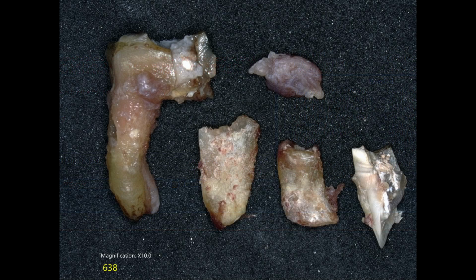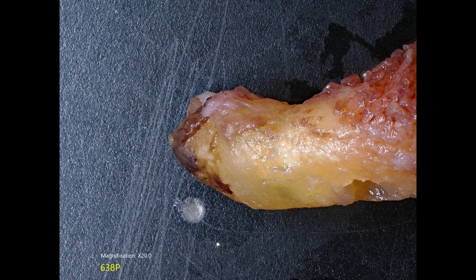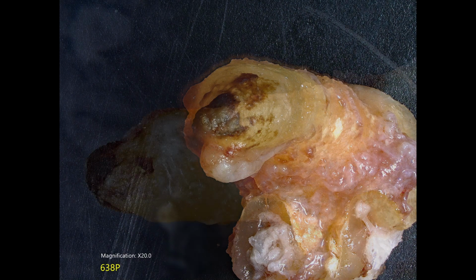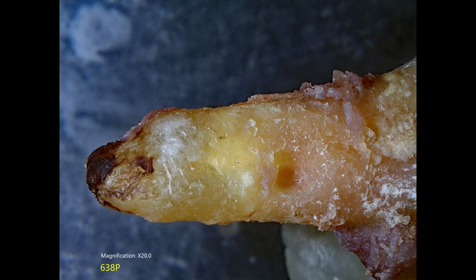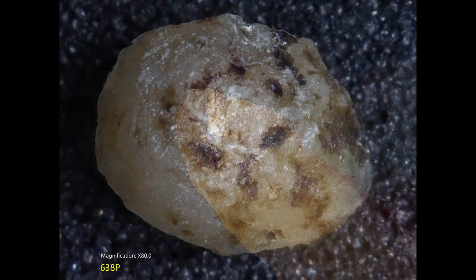it to me. I got the tooth in pieces in formalin, took some pictures of it, and we're going to look at the palatal root first because that was the only one really that was intact. And looking at the periapical area, it looked like there was a lesion around the palatal root attached to the root. That was scraped off. And then the root tip was severed just so we could look at the external surface of the root first.